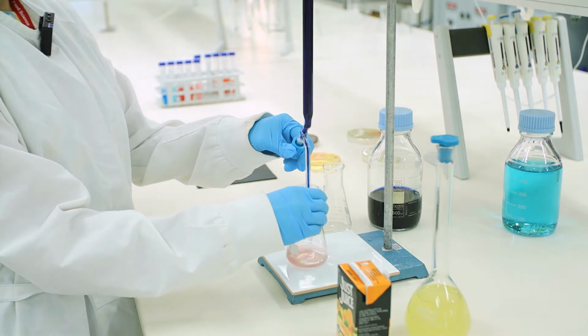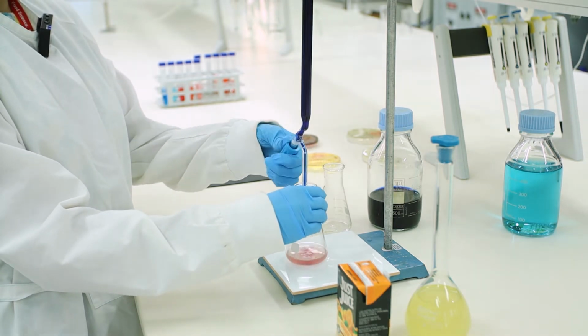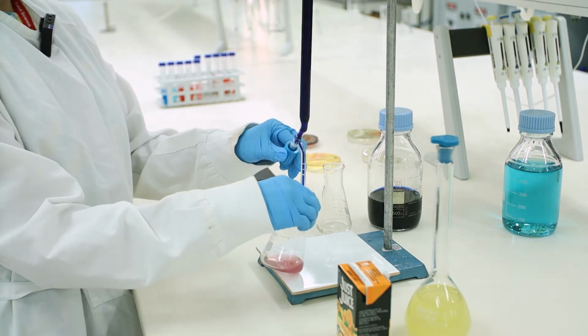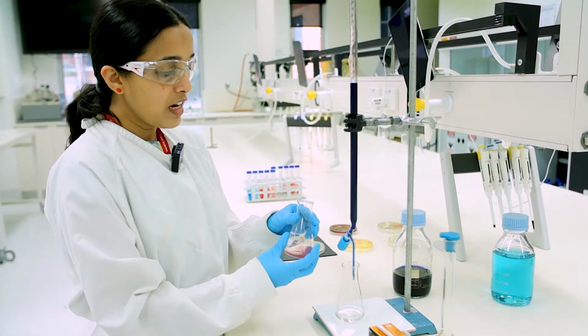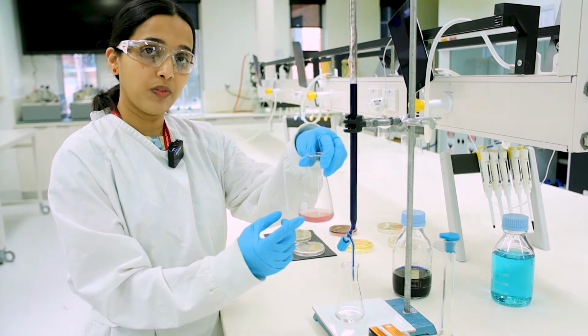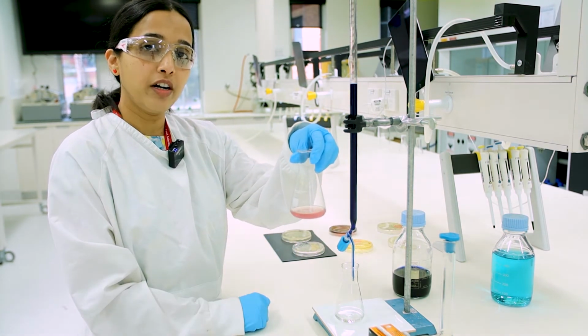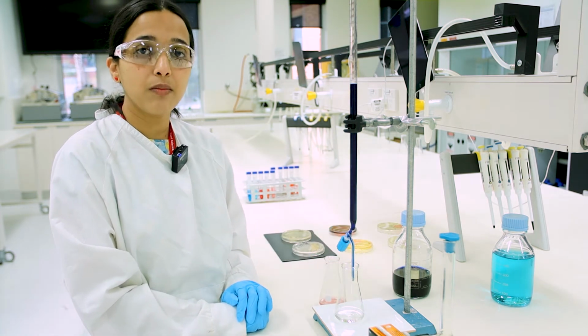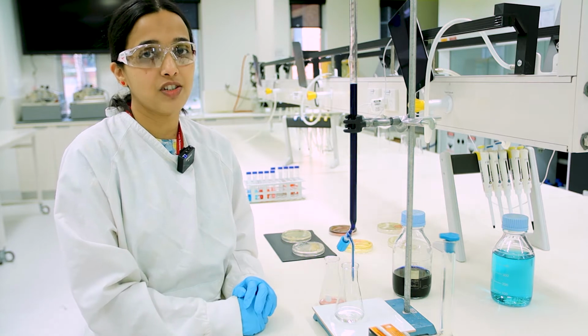So in other words, our students bring about a chemical reaction and they're trying to find out the presence of vitamin C in this fruit juice. At the end of the titration reaction, they end up with an endpoint color change, and based on this reaction, they can then go on to estimate the presence of vitamin C using some more calculations.